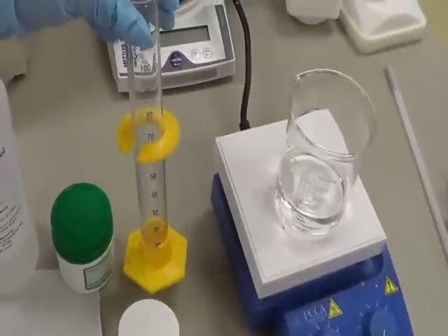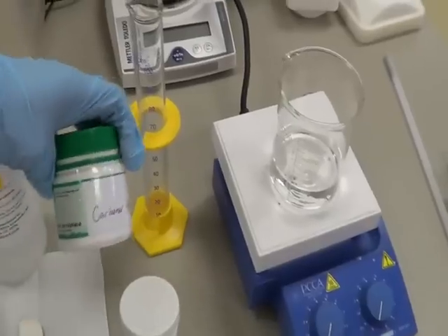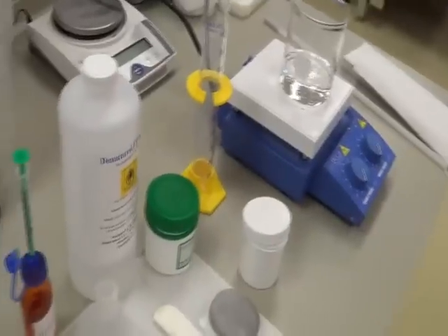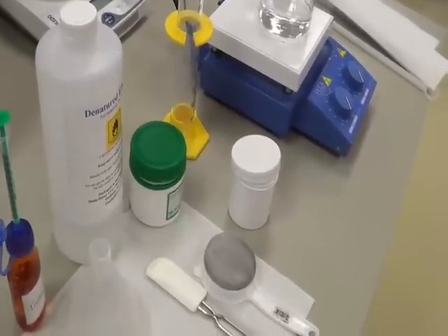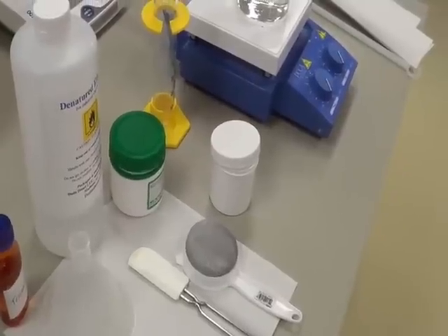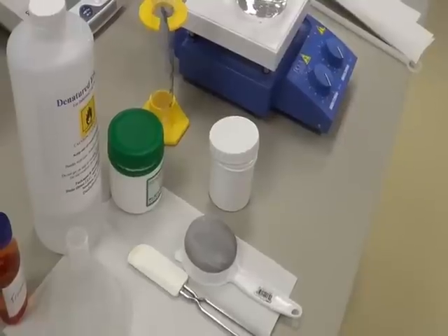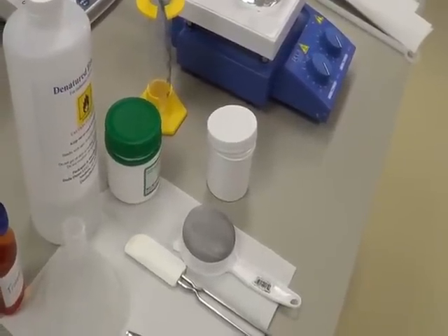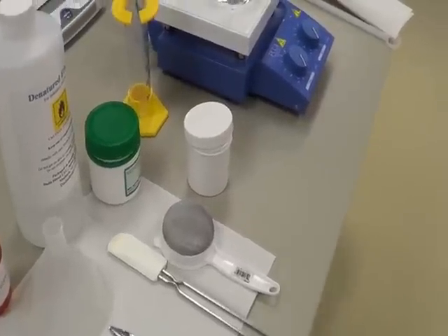I used the measuring cylinder to measure 100 ml of 70% ethyl alcohol. Also we need a carbomer. Carbomer is basically a bioadhesive material which is used as a controlled release agent, an emulsifying agent, an emulsion stabilizer or a rheology modifier. I hope you know what rheology is — we discussed it last semester. It is also used as a stabilizing agent, suspending agent, and tablet binder.